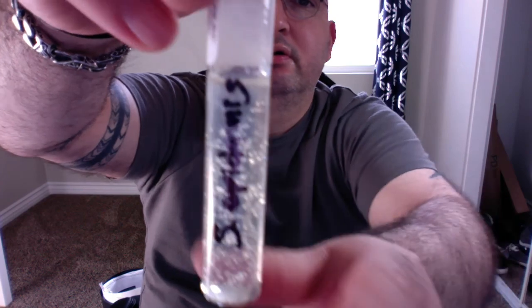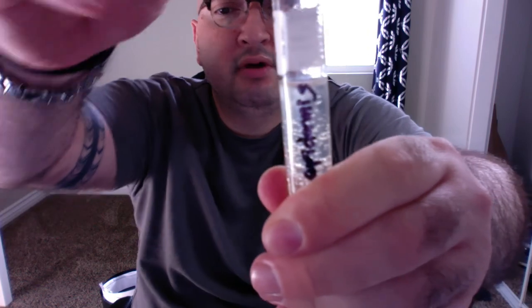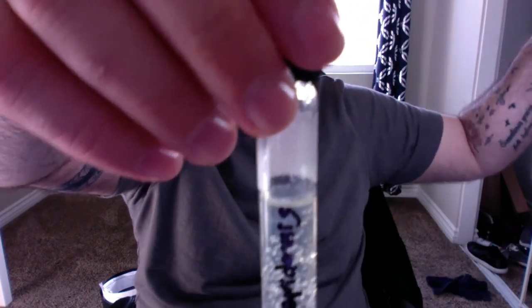So it's clear that E. coli is motile. Now, here's my S. epidermidis motility agar, and it's incubated for the same amount of time, and you can see just on top, just a little tiny disc, and perhaps that can be considered turbidity. Not 100% sure, but even when I shine a bright light, it's clear. So there is no motility here whatsoever. No flagella, nothing.